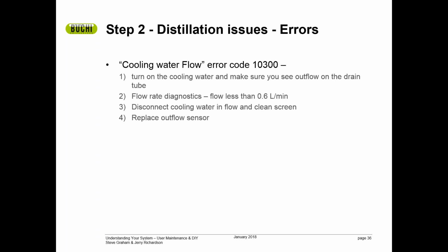One is a very simple fix. Turn off your cooling water, go to the back of the instrument where the cooling water inlet is, unhook the cooling water inlet, and you will find a screen on the back of the instrument where that cooling water comes into this system. If you're using tap water, this is quite common after many years of use, that you need to clean that screen off so that you do get adequate flow. The other reason you'll get this error can be the outflow sensor that actually looks at the flow rate. If that is in error, then the best policy is to call BUCHI service and let us replace it.